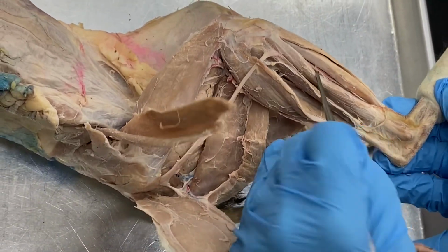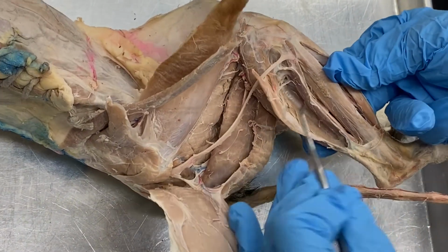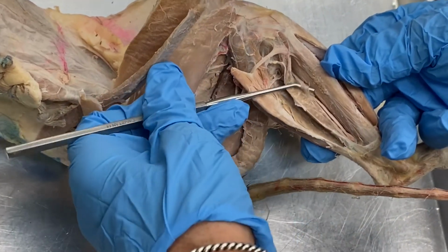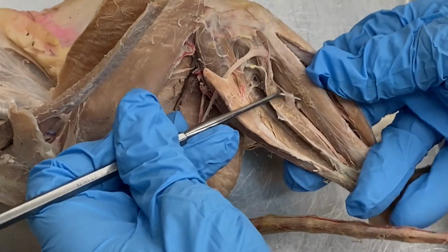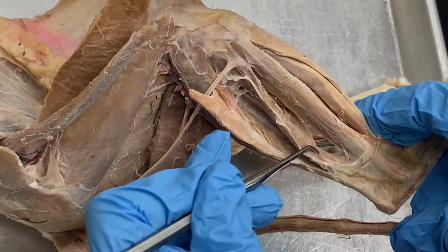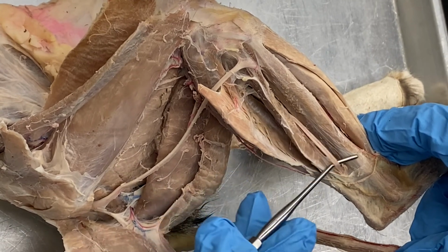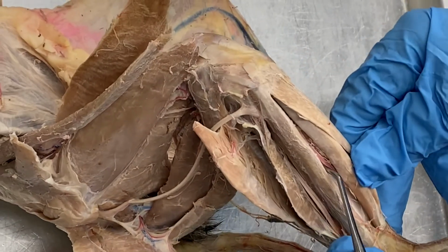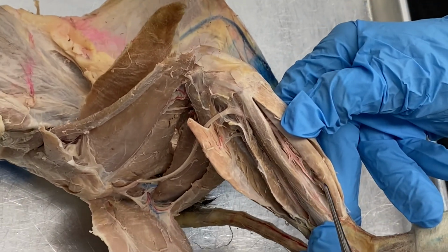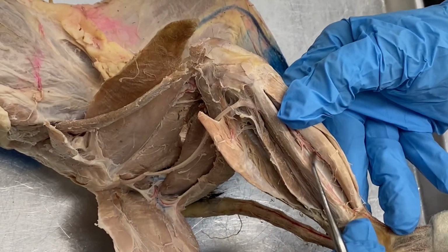If you look in the posterior surface of this leg, you might be able to see this is probably a branch of the posterior tibial artery. Like I said, it's sometimes difficult to find these arteries. This looks like maybe an artery running with the nerve. And then the anterior tibial artery is in the anterior compartment, and you can see it clearly here, anterior tibial artery.